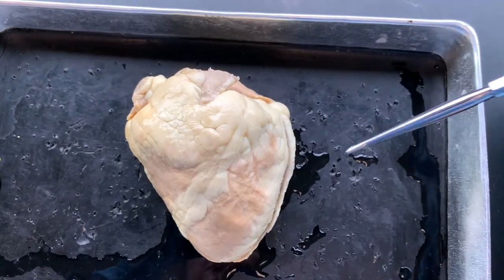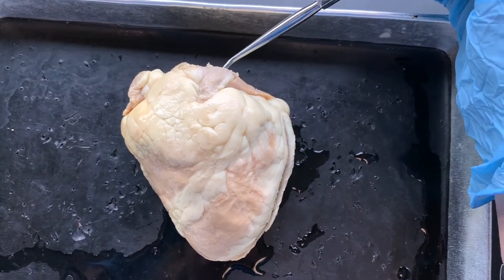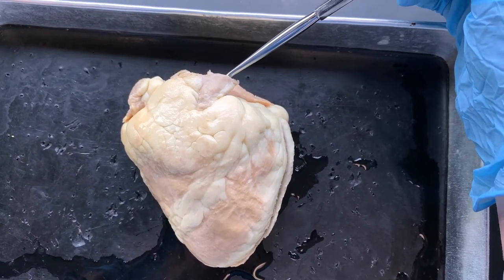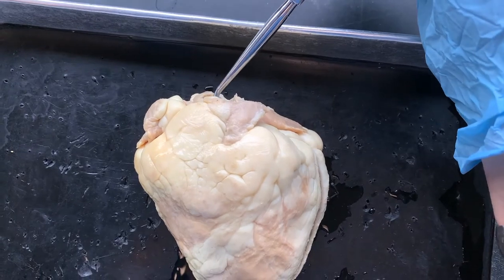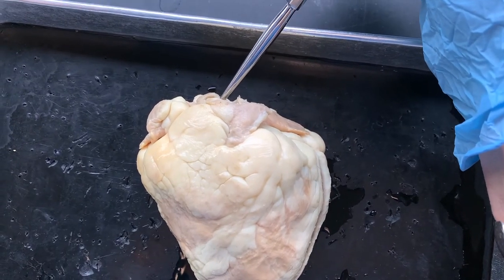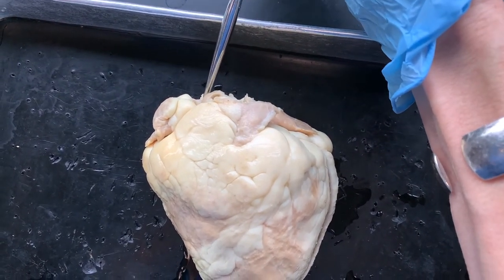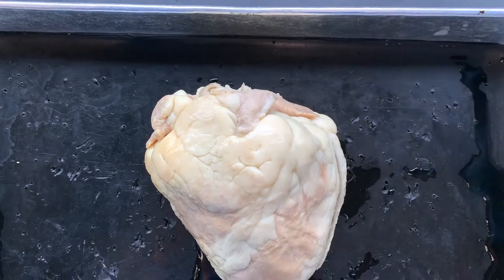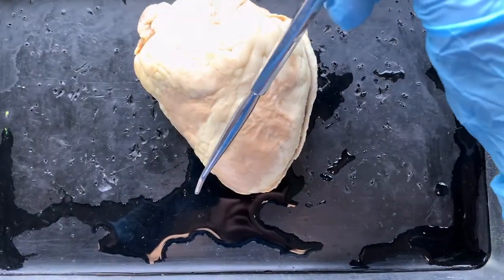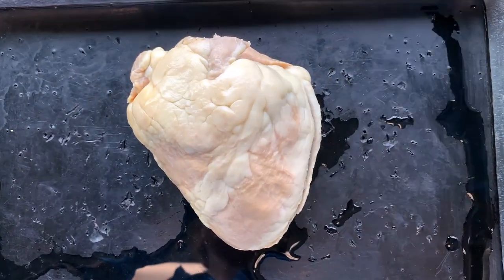Alright, so one more time: there's the pulmonary trunk. Right behind it would be the aorta, and then behind that would be the superior and inferior vena cava, and the anterior interventricular sulcus.